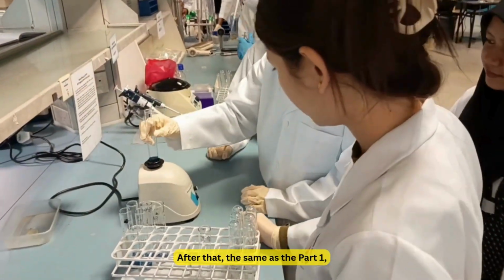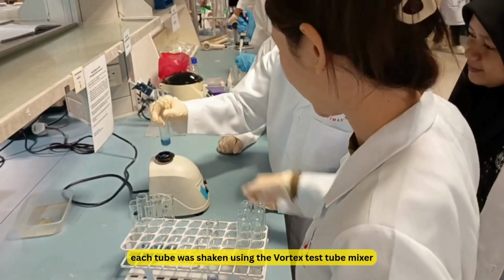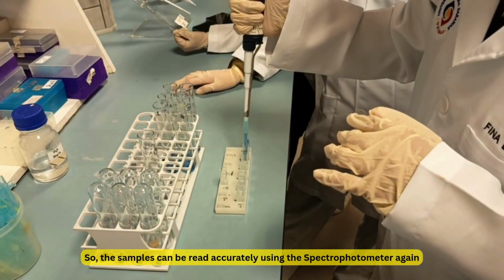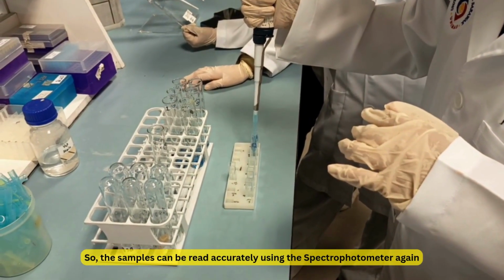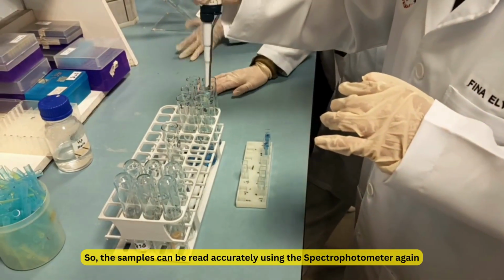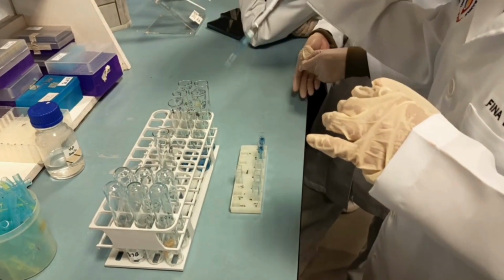After that, the same as part 1, each tube is shaken using a vortex test tube mixer, so the samples can be read accurately using the spectrophotometer again.